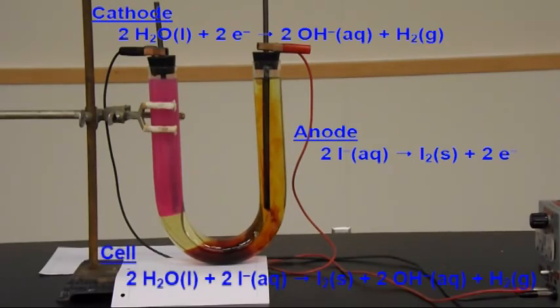Reacting to produce I2 solid plus two OH minus plus hydrogen. That's coming off as a gas. The cell potential should be something around negative 1.364 volts. That's nice.